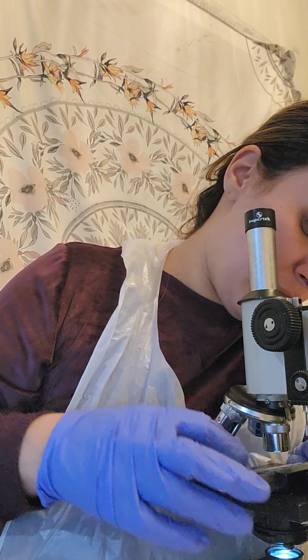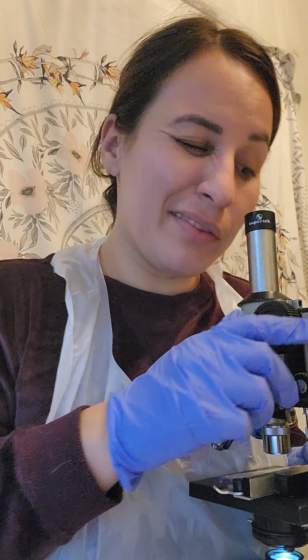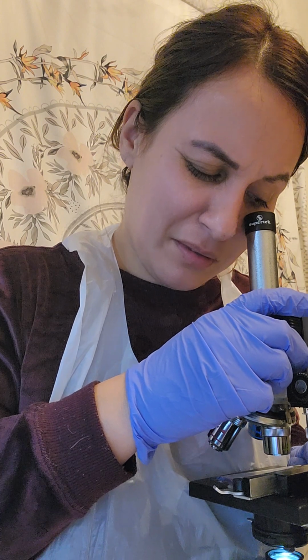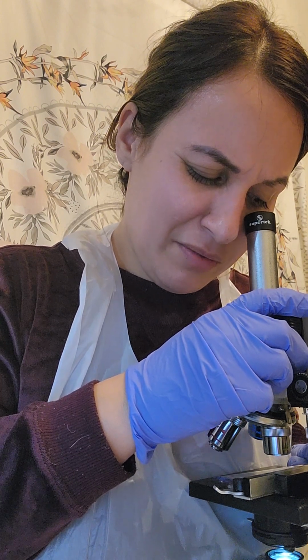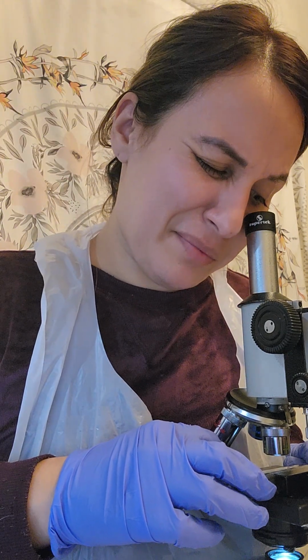Another thing I've learned is making sure the light is passing through. You had mentioned that to me, and it was very helpful in getting me through this. Okay, so we got that done, and it comes into focus pretty quickly.